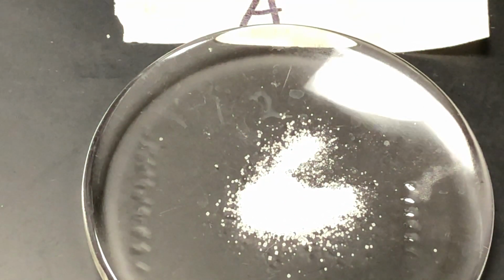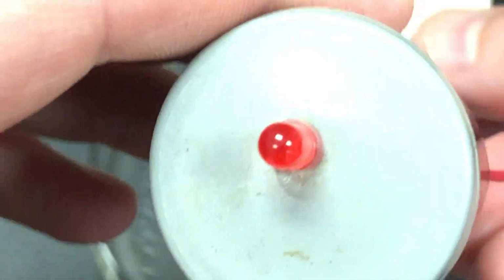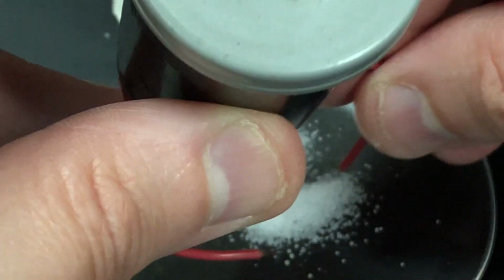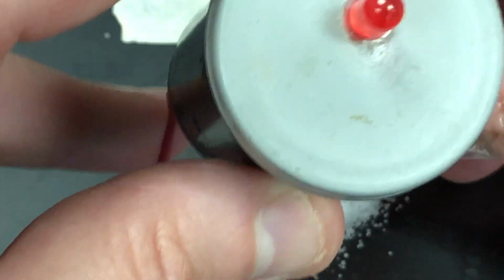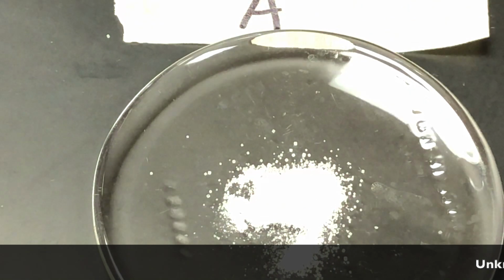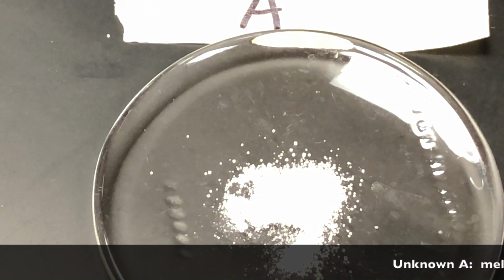So then we'll test the conductivity. Now, if it conducts, then you'll see that it lights up. I'm touching the wires here. So let's watch what happens when I put them in. And as you can see, it's not doing anything. So dry does not conduct.